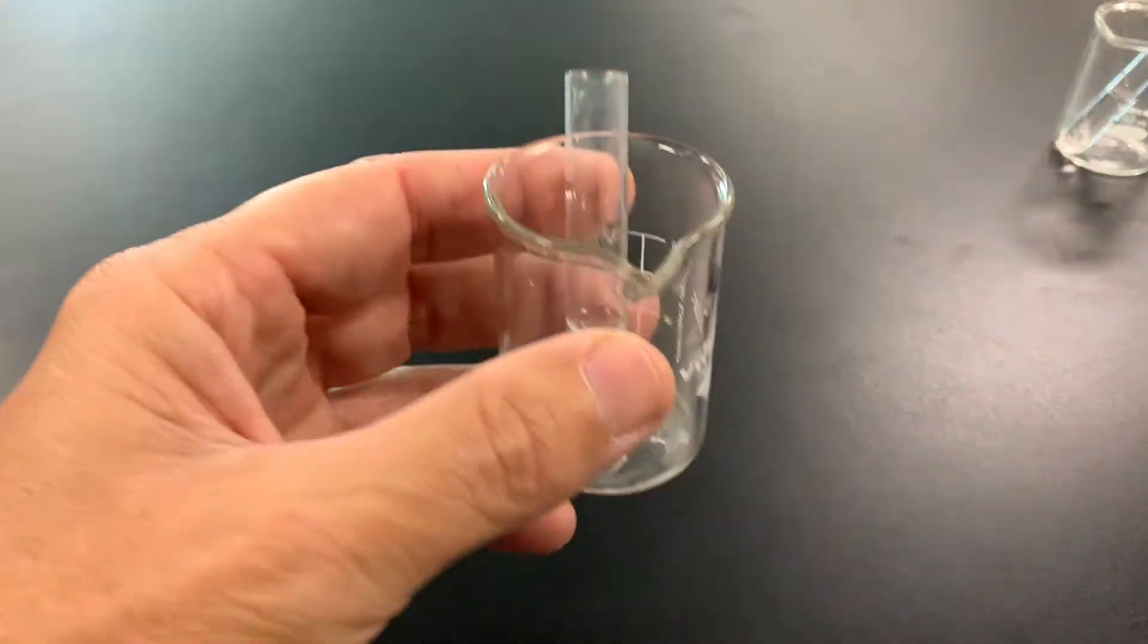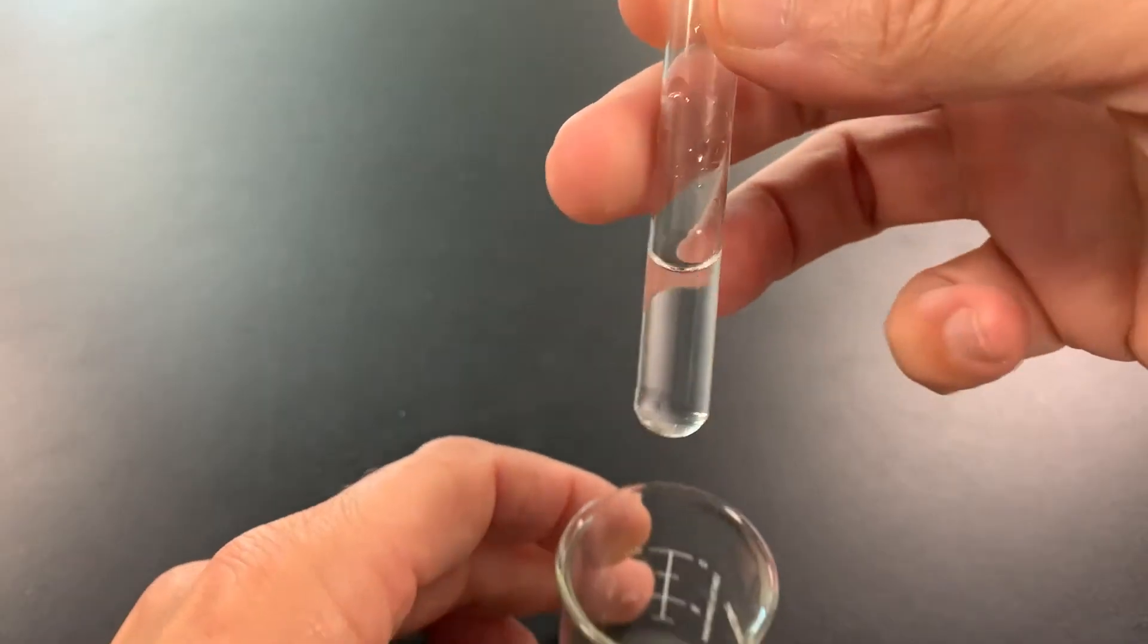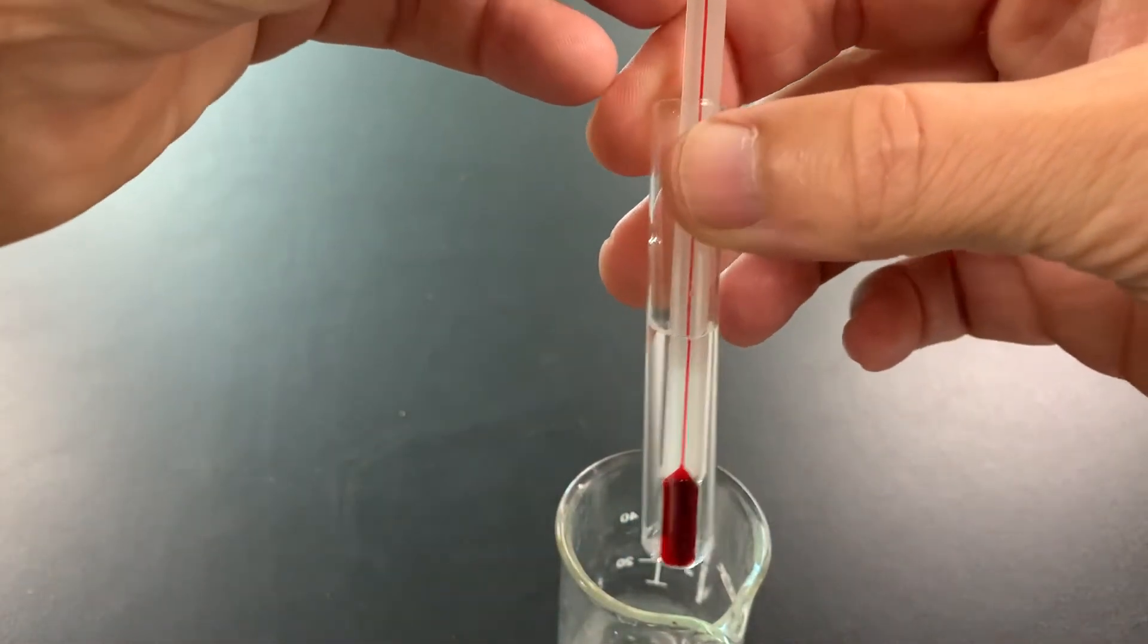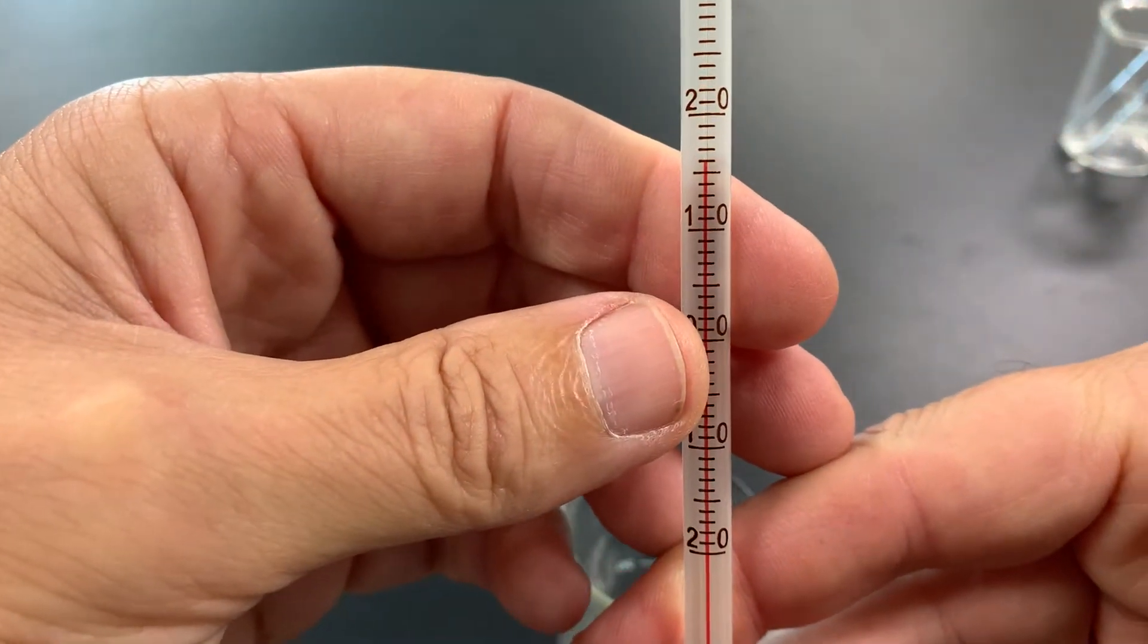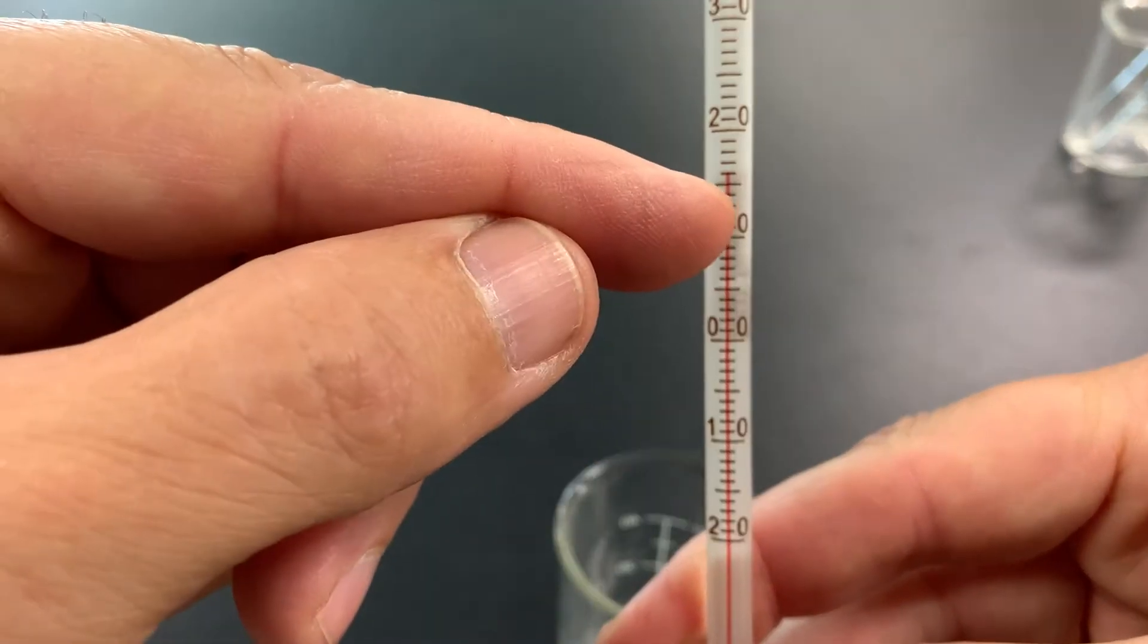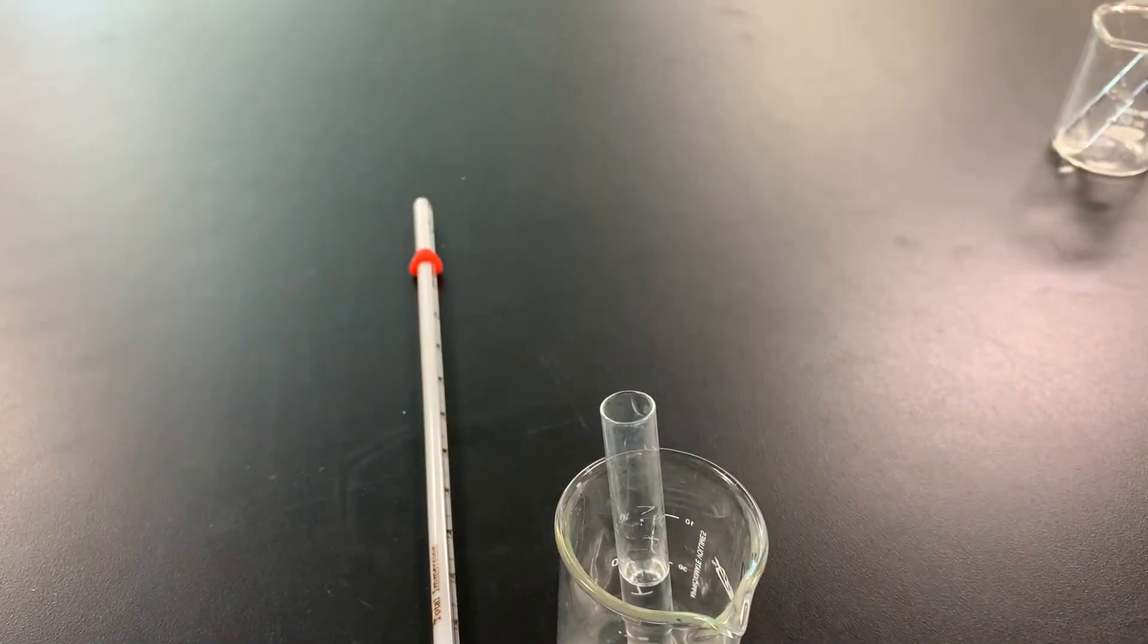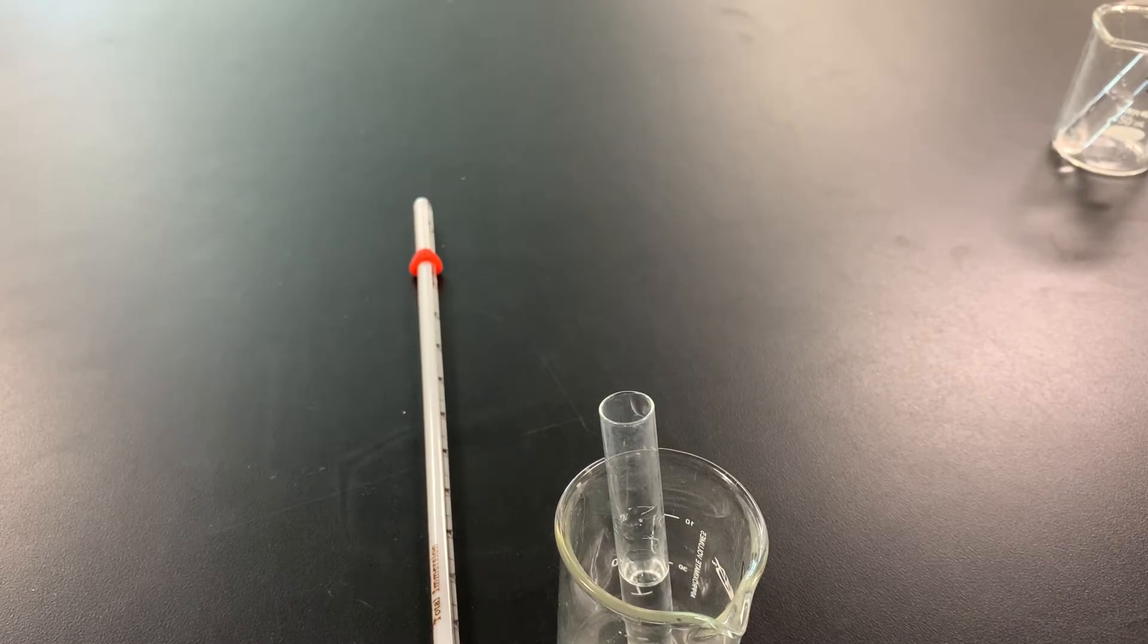Let's start with the hot pack. To do that, I'm going to take this little beaker with this little baby test tube, and I'm going to measure the temperature of this water, because we need to take a before temperature of the water. Let's check our thermometer. Looks like it's at 16 degrees Celsius. I'm going to write that down on the paper.